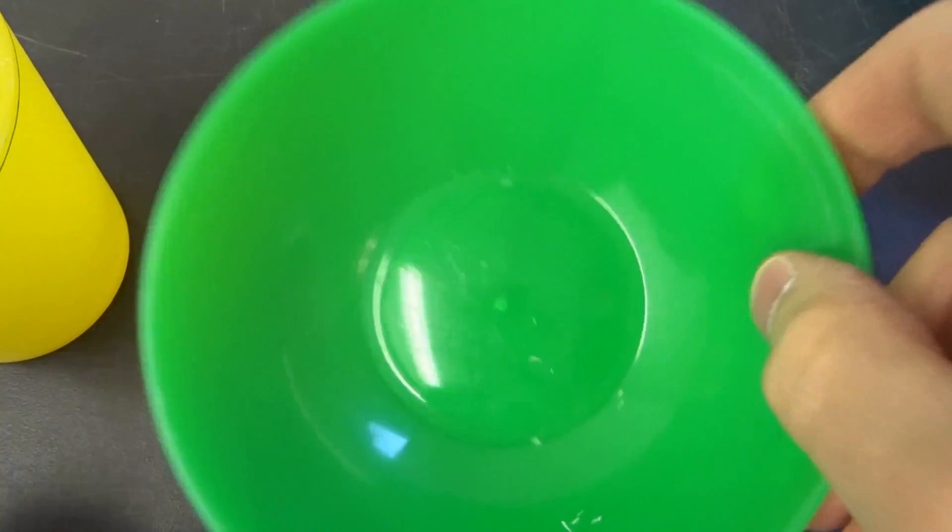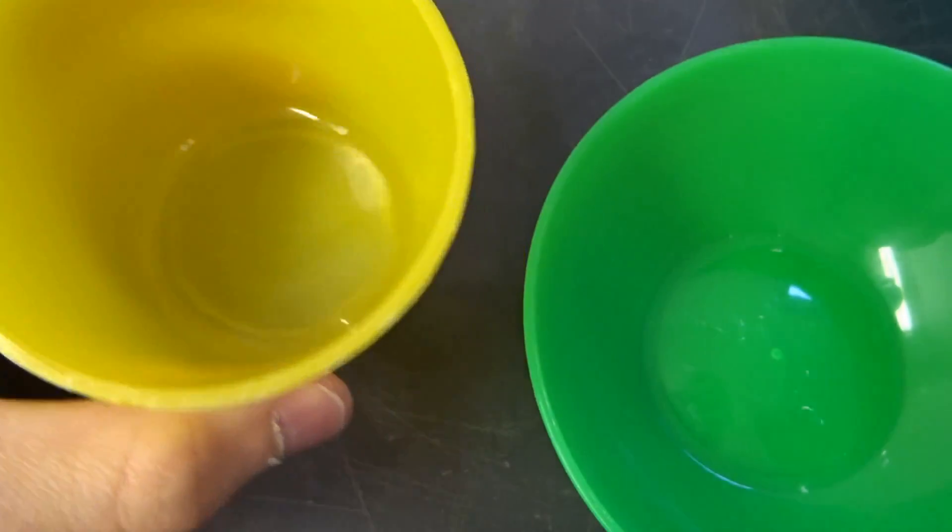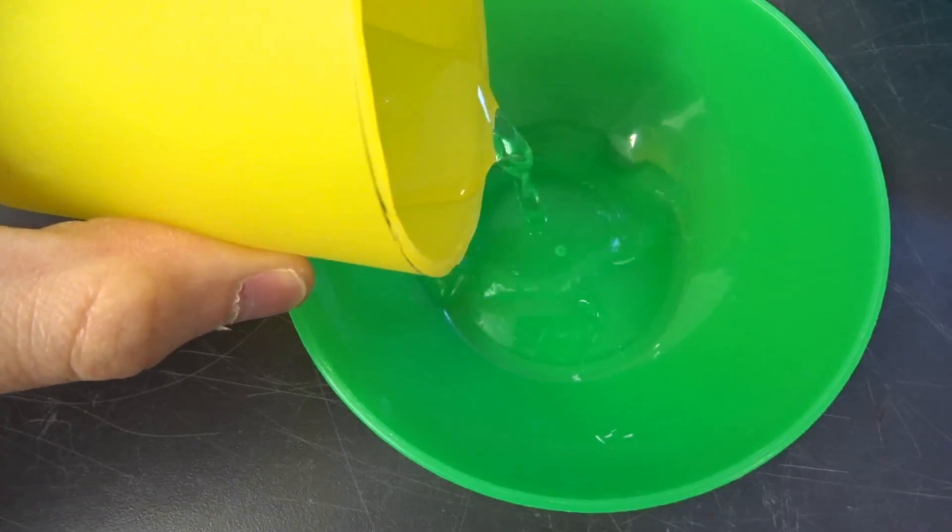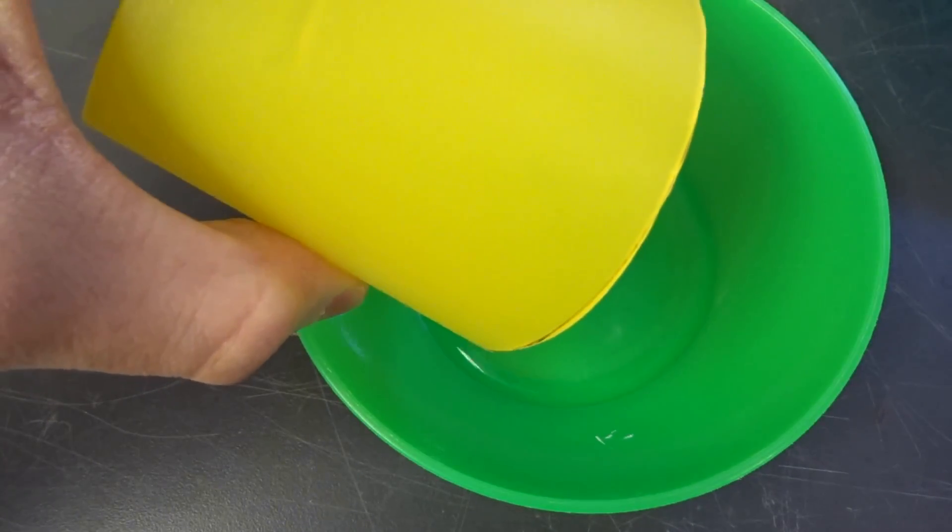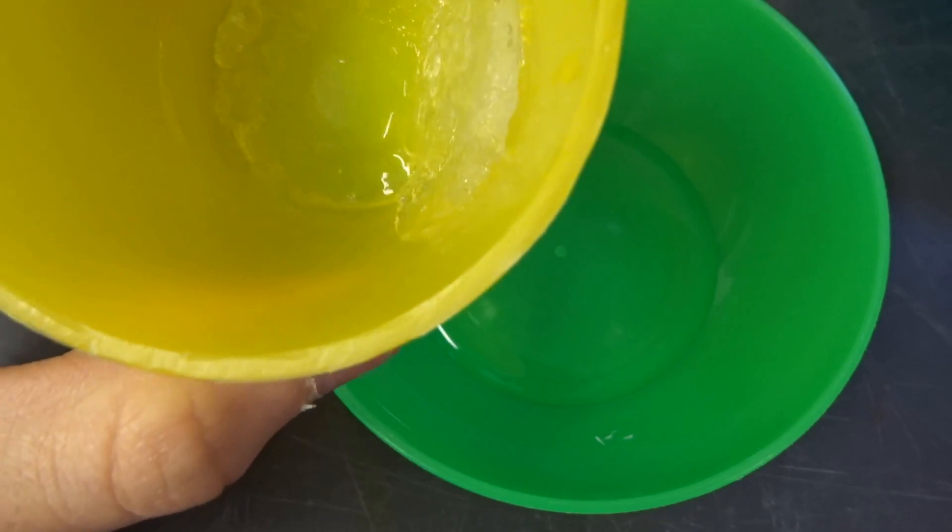And I'm going to pour them off one after the other. So I'm starting with this one, and then you get a first impression on how these things look like. So there is some water, which did not take part in the reaction. So the gels formed.